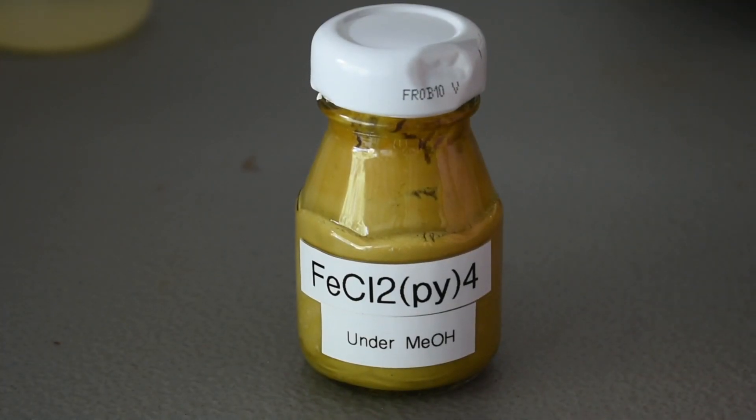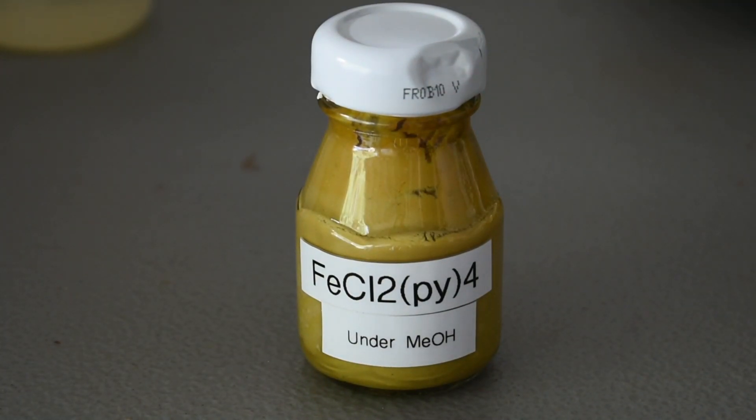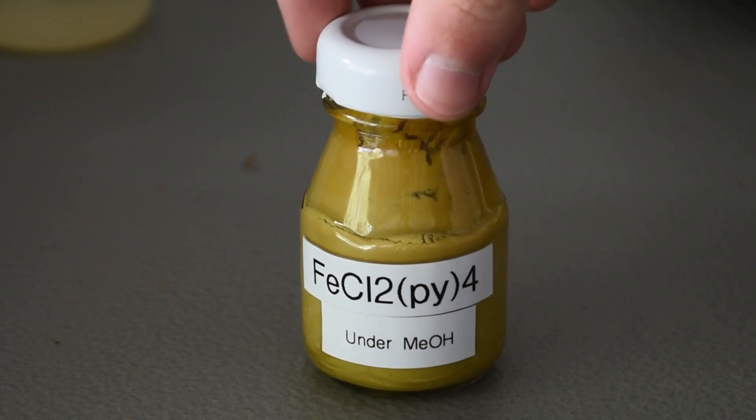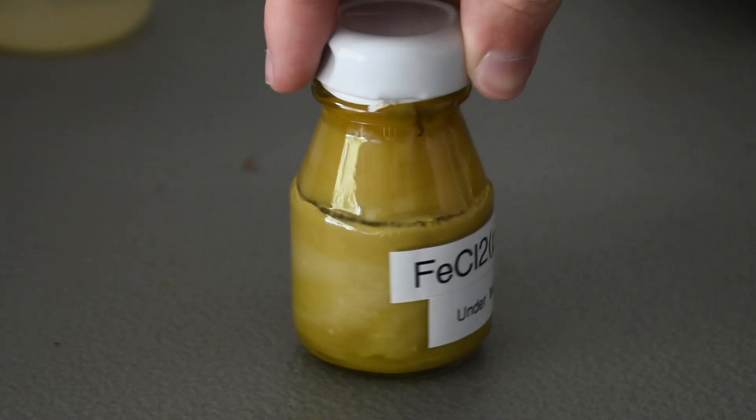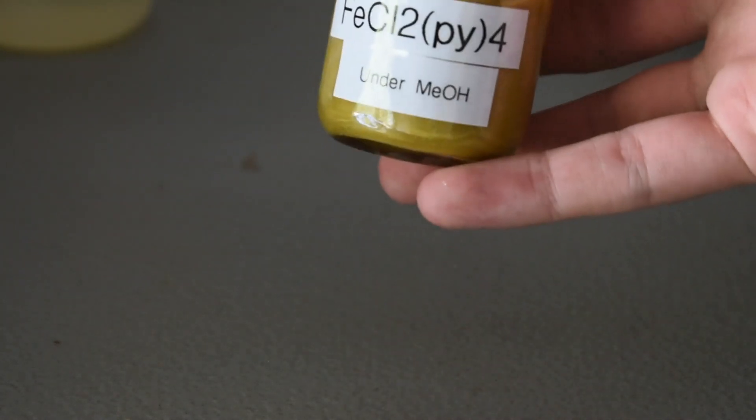It would obviously be a lot better if you were able to do the synthesis under oxygen-free environment. But I do not have that capability as of now. So this is the best that I can do. But I'm pretty happy with the result.